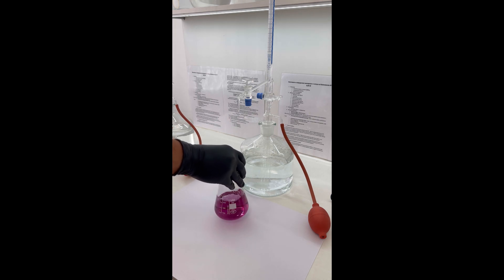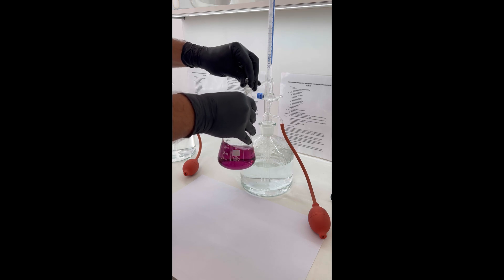To this, we add 10 milliliters of 20% potassium hydroxide to adjust the pH, followed by calcon carboxylic acid indicator. The solution should turn bright pinkish purple.